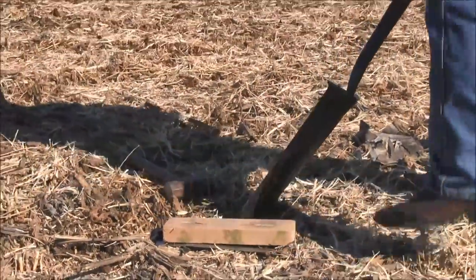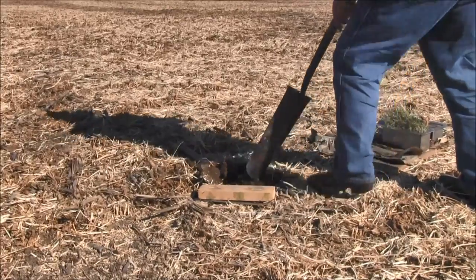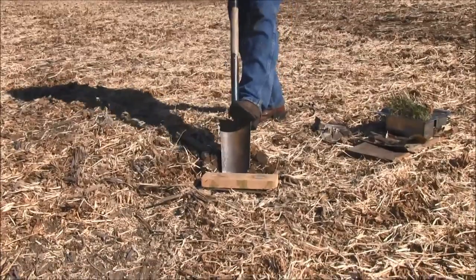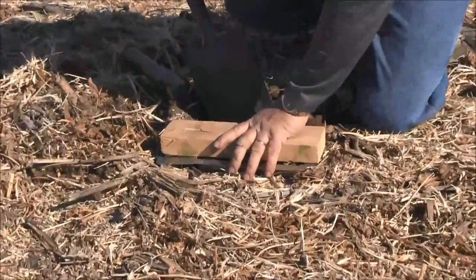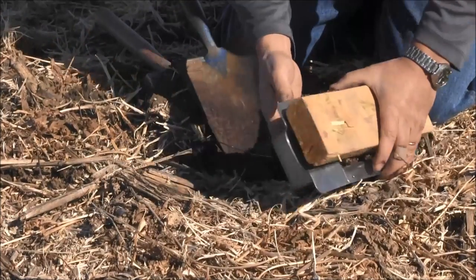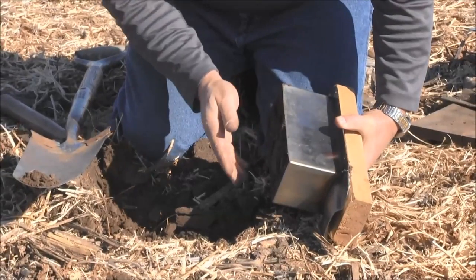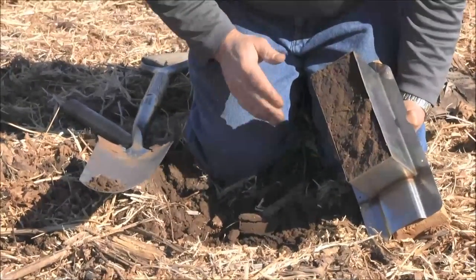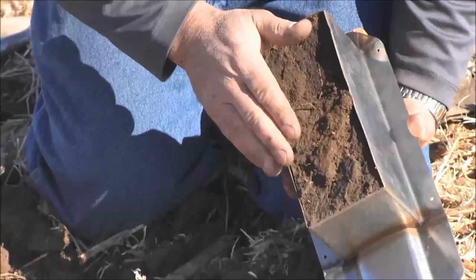I'll put that 2x4 on the top of it. I'm not digging a hole all the way around everything — I'm just taking out enough so that I can get my spade underneath the cutter itself and to the bottom of that sample. Try to take it off as uniformly as possible. In this particular case, we've got a platy layer down in this no-till system that's an area of compaction.